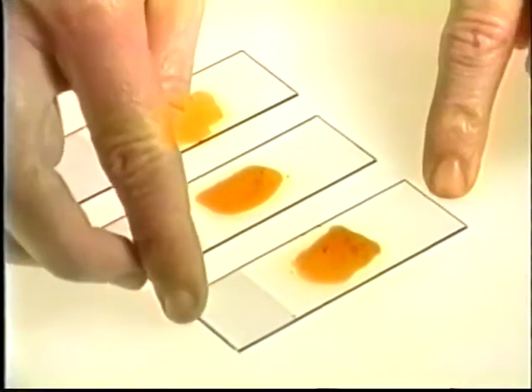If there are several slides, make a quick assessment and start working with a slide that shows multiple fragments. If no fragments are visible to the unaided eye, the harvest is probably non-diagnostic, and the repeat thin needle aspiration biopsy may yield better material.